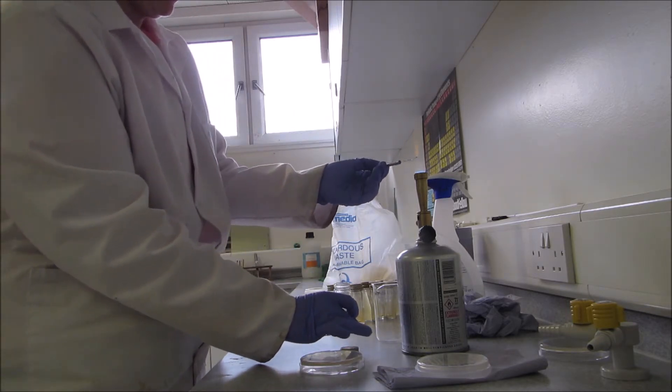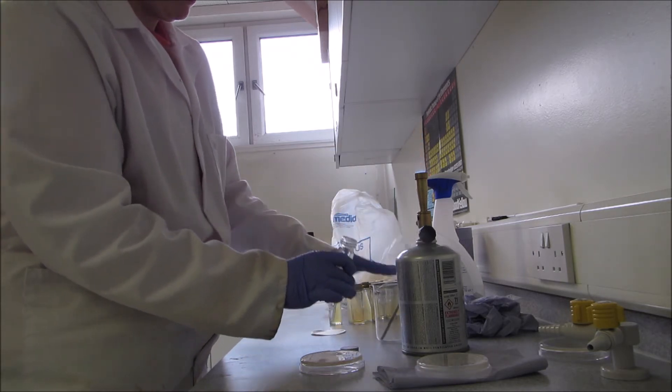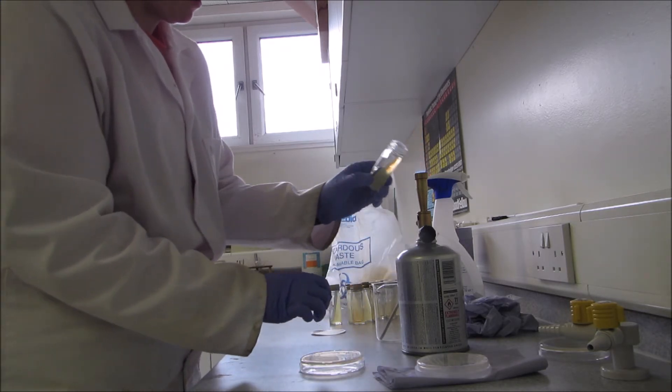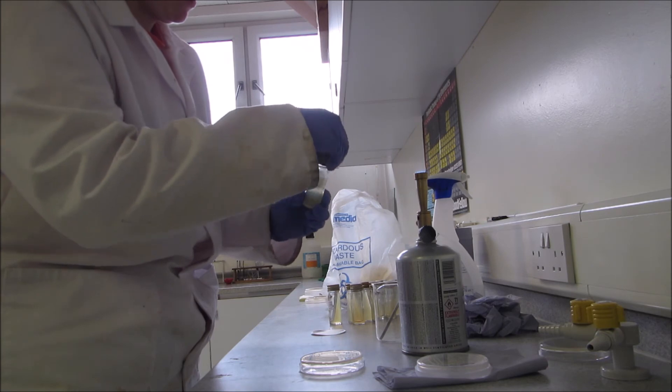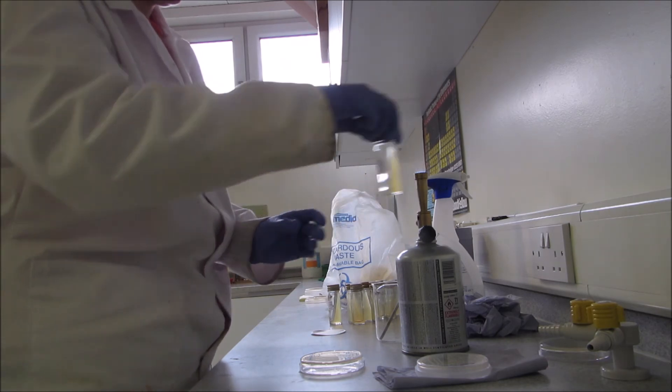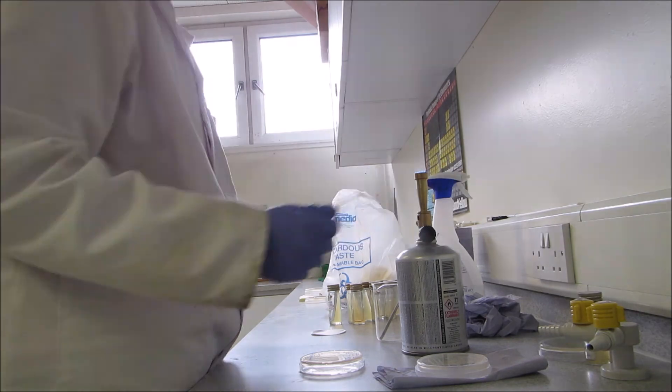Flame in the loop, and before I close it I'm gonna flame it. Put the lid on loose, flame again and put it tight, and again that's ready to go in the incubator.